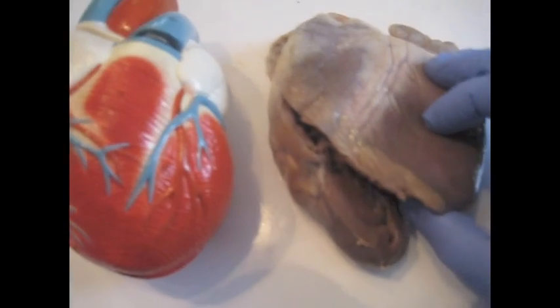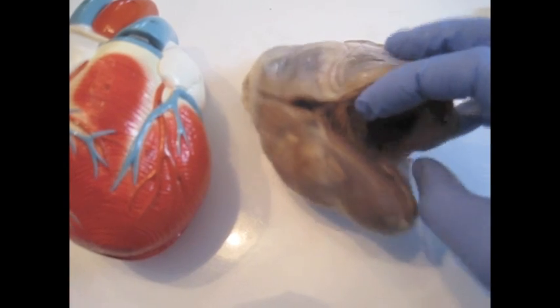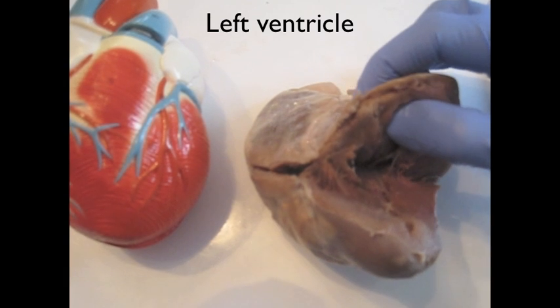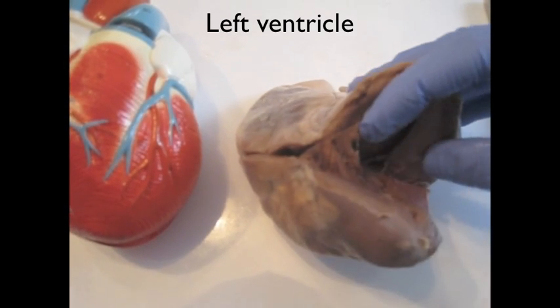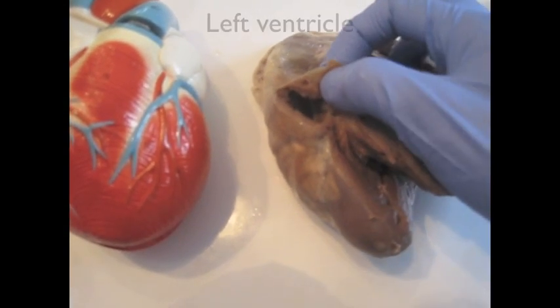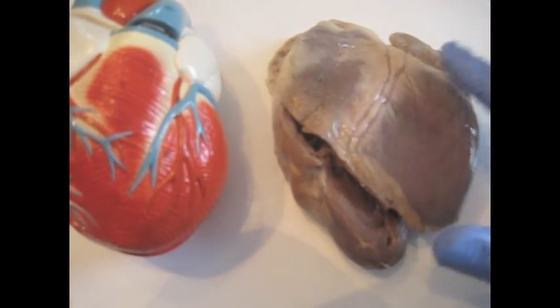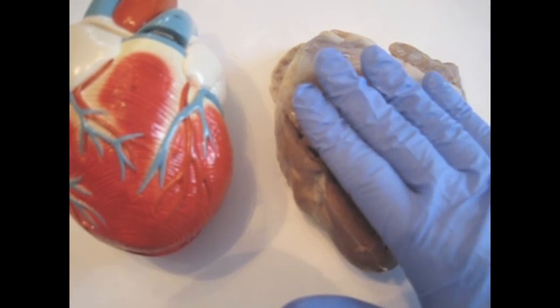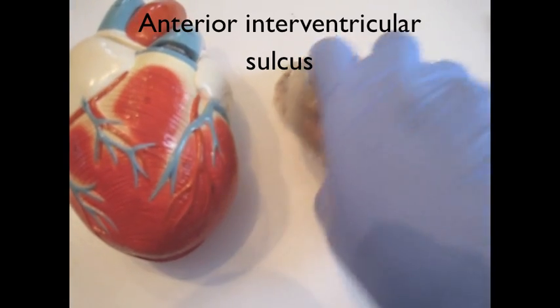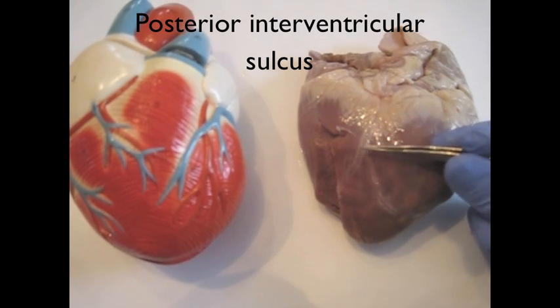But how do you determine what's left and right? It's useful to look at the walls of the ventricles, because the left ventricle has a thicker myocardium. So if you look at the actual walls of the ventricle, you can see that this has a relatively thick myocardium — it's the left ventricle. You can compare this to the walls of the other ventricle, which are rather thin, so this is the right ventricle. Now you've determined left and right, which means this is the anterior side of the heart, meaning this is the anterior interventricular sulcus. And now you also know the posterior side of the heart and the posterior interventricular sulcus.